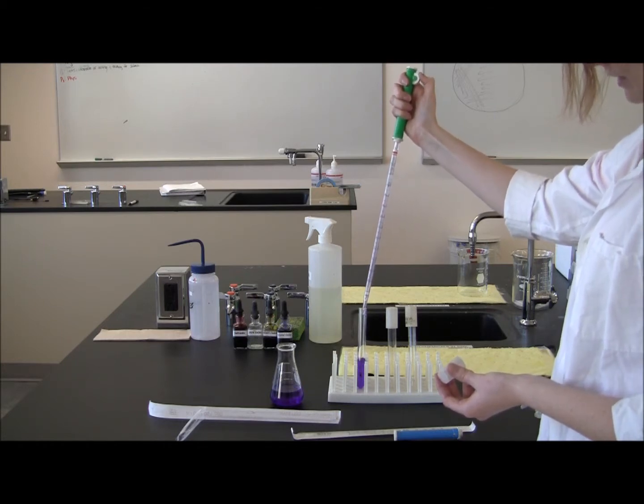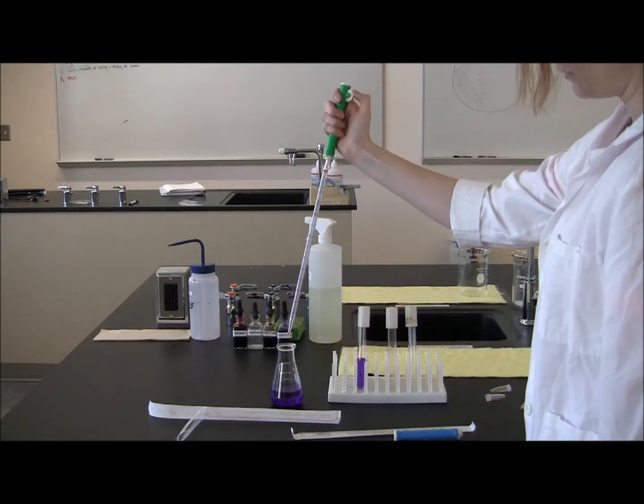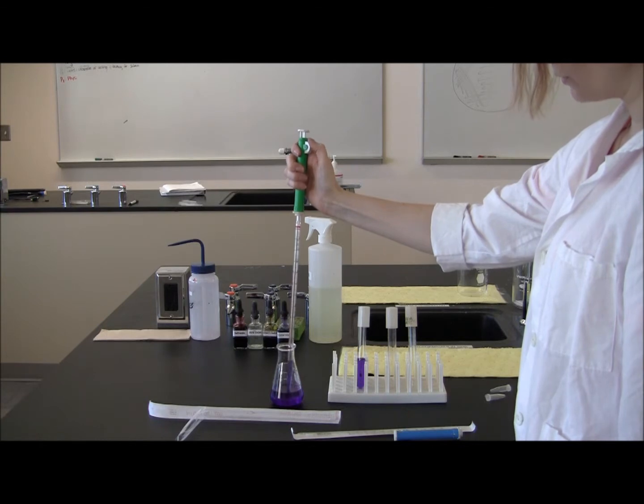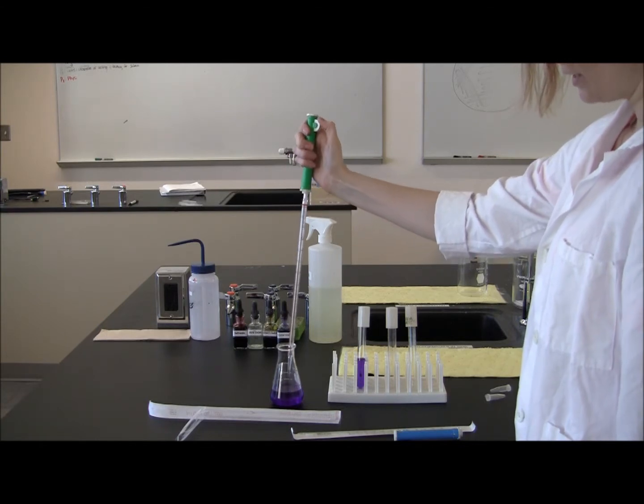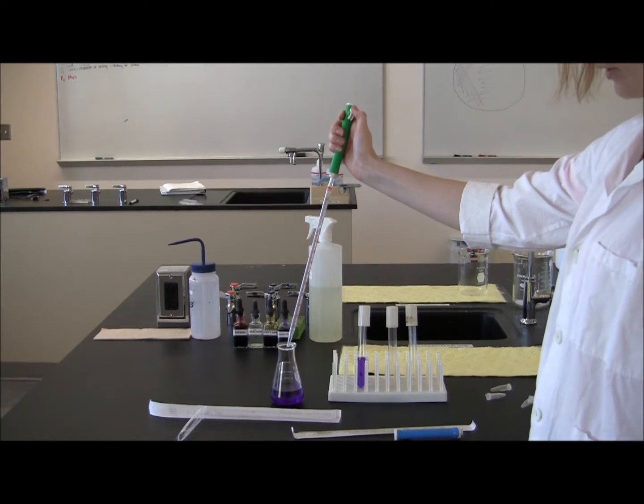Once all the liquid has been expelled into the tube, replace the cover. And if you need to take more samples, you can do so, or you will dispose of your pipet tip. These pipet tips are plastic, so they go in the biohazard bin, not in broken glass.